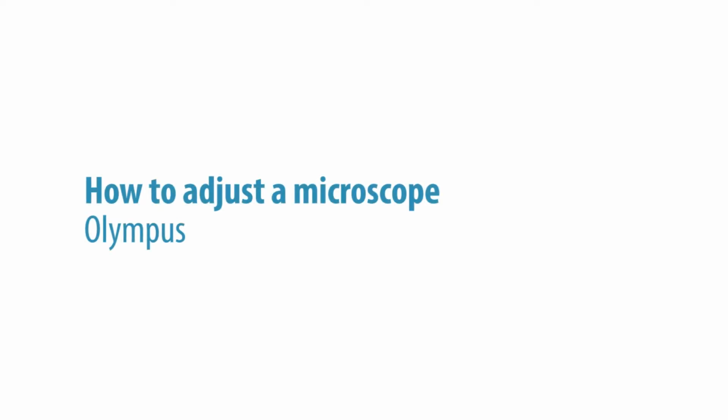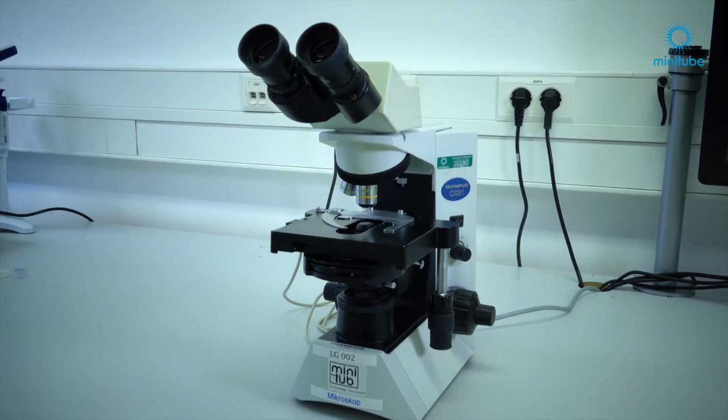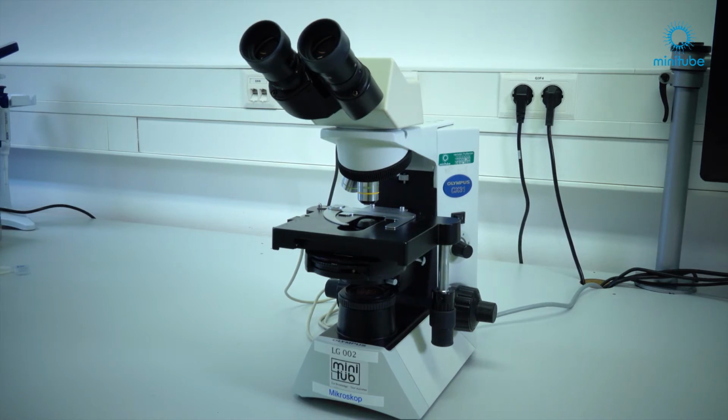Hello everyone! I would like to show you how to set up an Olympus microscope according to Köhler. This video shows the Olympus CX31, but all the other Olympus microscopes have the same functional elements. At first, I would like to show you the basic elements of the microscope.